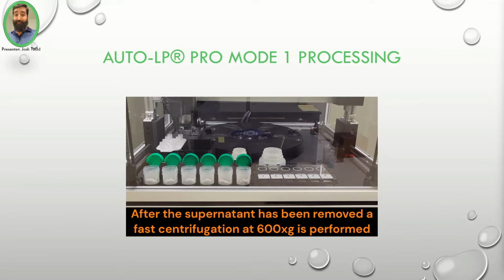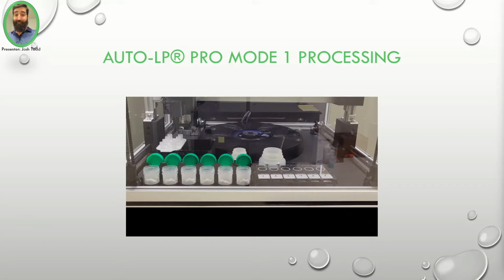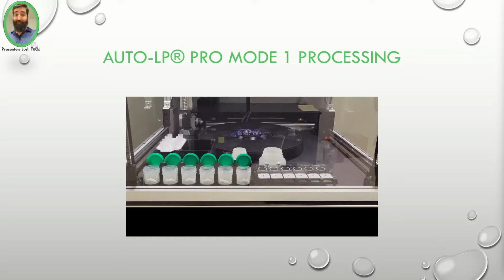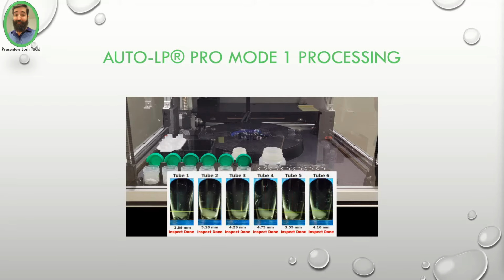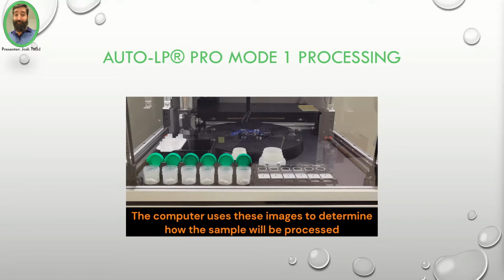After all the supernatant has been removed from all the specimens, a fast centrifugation to 600 times G is performed. After centrifugation, the vision program will next take over, taking pictures of each of the cellular pellets to determine how the AutoLP Pro will process them.